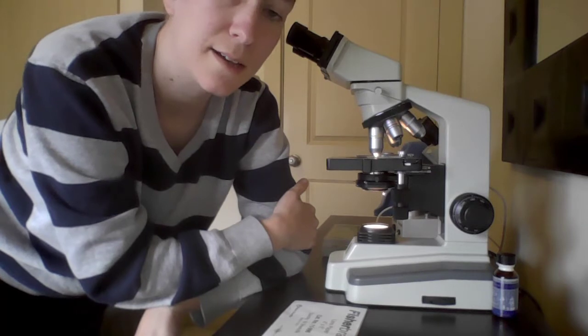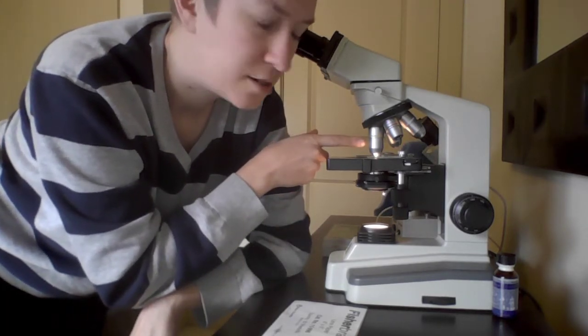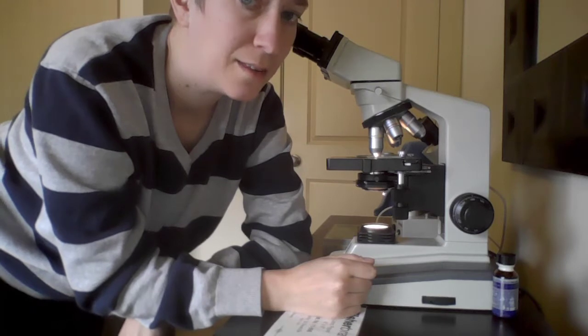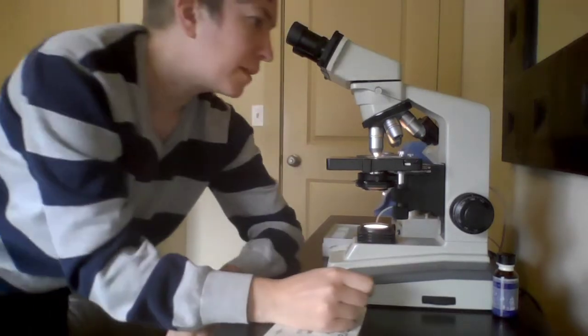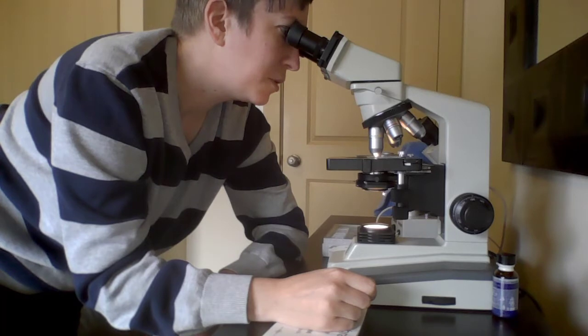So one mistake I see people making is that they get afraid that their lens is going to touch the stage or the slide, and so they move the stage down, and then they're completely out of focus and can't see anything at the next magnification. So keep the stage at the same place where it was in focus, go to 10, and then look through. Now I can still see it, but it looks really blurry.